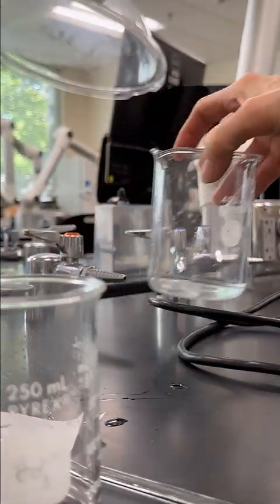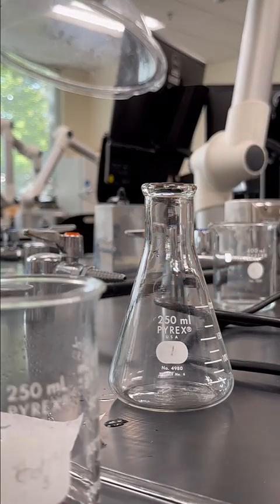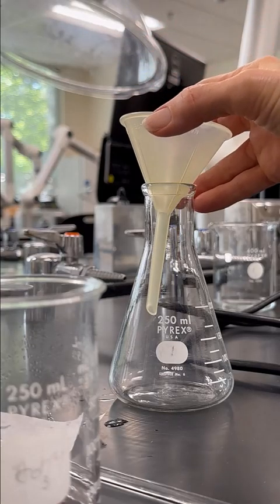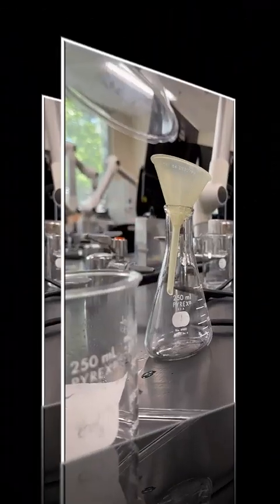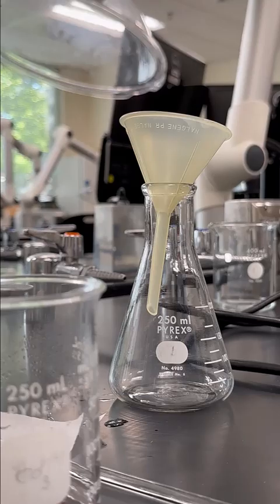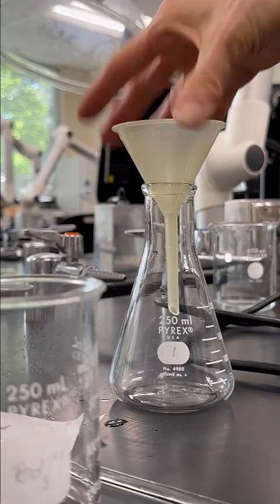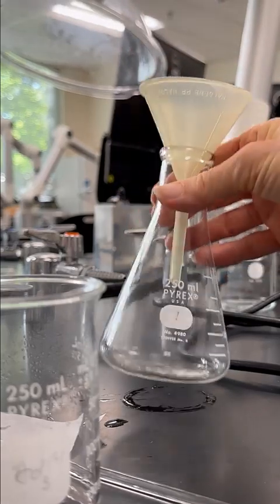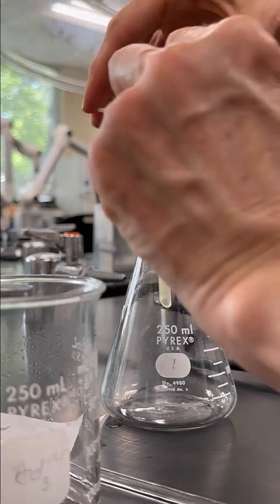So setting up the filter, we are going to use an Erlenmeyer flask, and we are going to set up our filter system in here. I'll show you how to fold the filter and set up your flask. First, anytime you're filtering by gravity and using a vessel like this, you can see this filter really seals around the Erlenmeyer mouth, and that will cause the filter to not be able to exchange air, and it will not be able to draw down the solution.